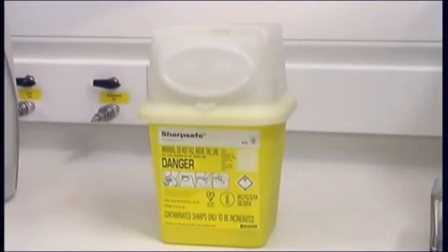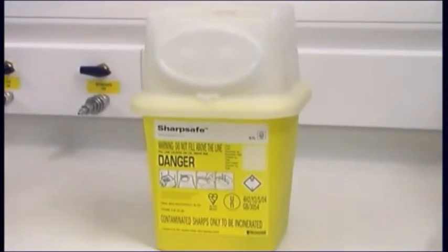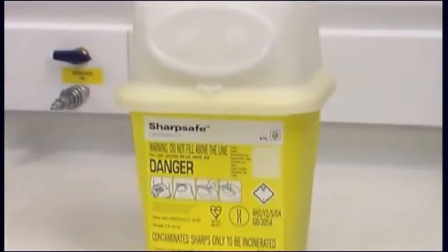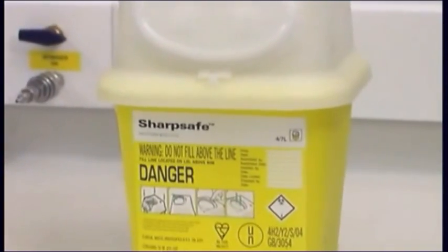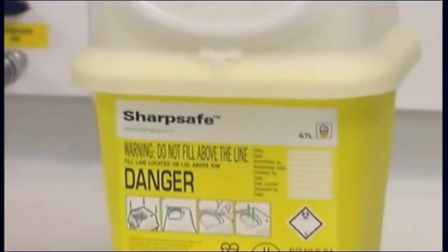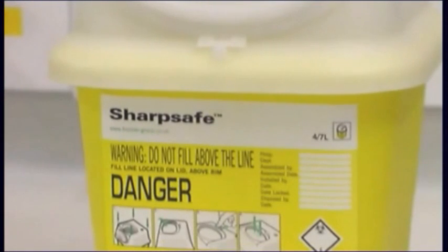A sharps disposal container should be used for waste such as broken glass and used needles. You must always dispose of biological waste safely in accordance with local legislation.